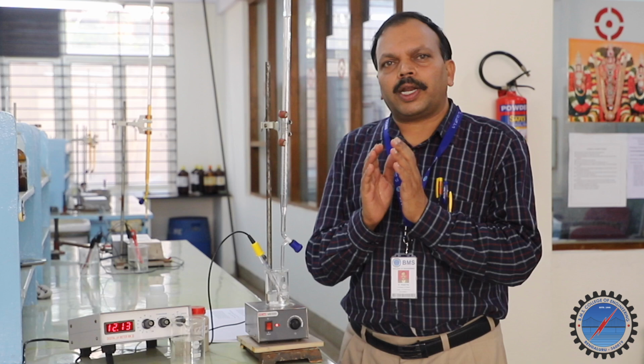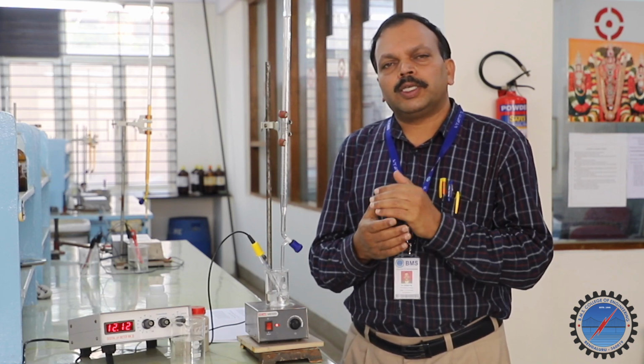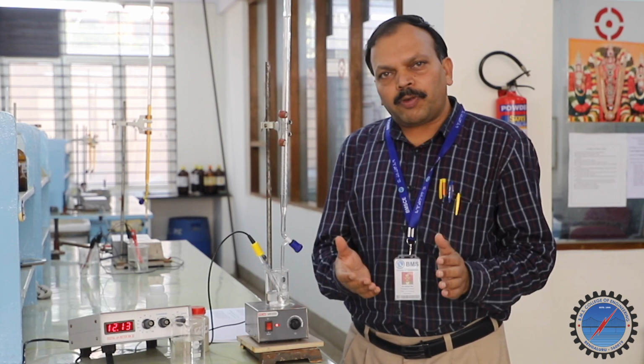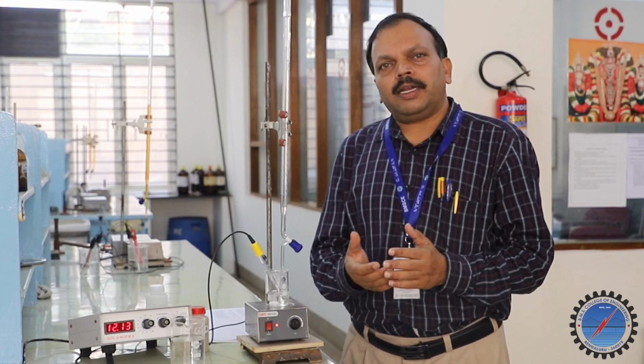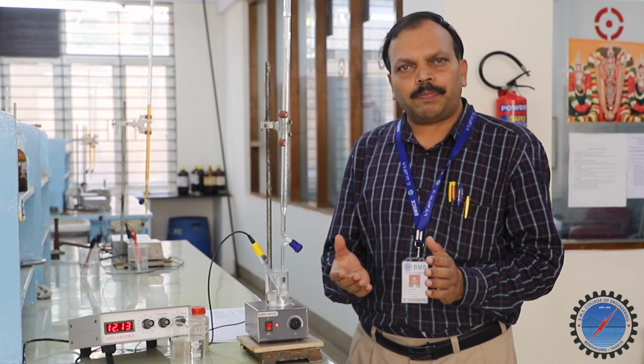That is how I am going to record the pH value from the beginning, 2 point something, 3 point something, to a slow increase, 4 point, 5 point something, up to 6, a gradual slow increase. There is a jump from 6 to 10. After the 10, further I added 0.5 ml. There is a slow increase in the pH value.